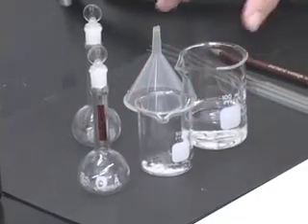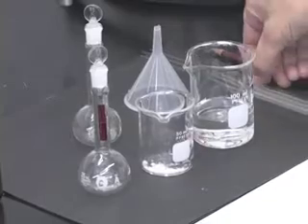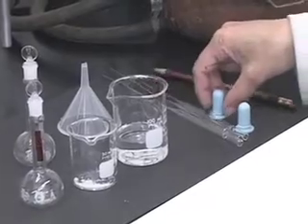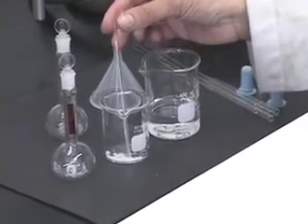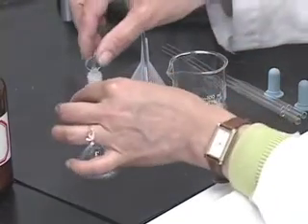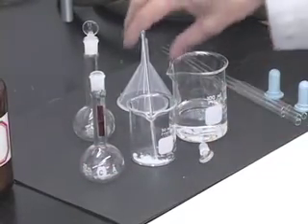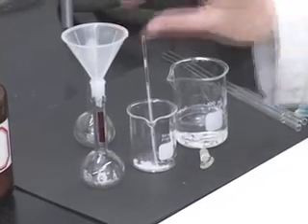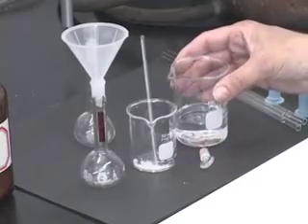Have your camphor in the beaker and ethanol ready in another beaker. You want a small stirring rod to make sure that you will be able to dissolve all of the camphor, and take off the stopper from the volumetric flask. Insert a small plastic funnel and start dissolving camphor using 95% ethanol.